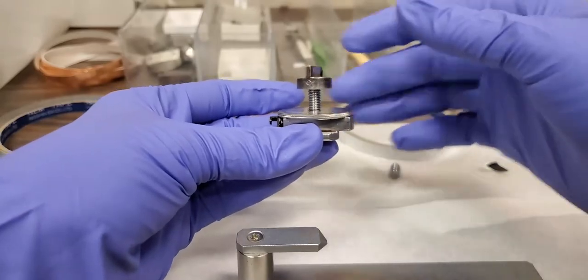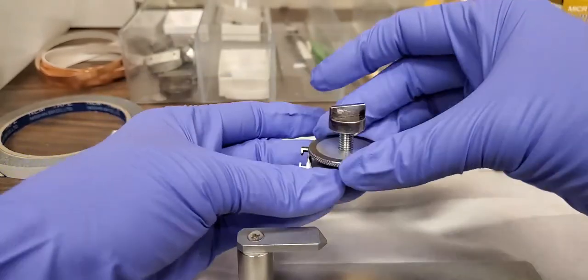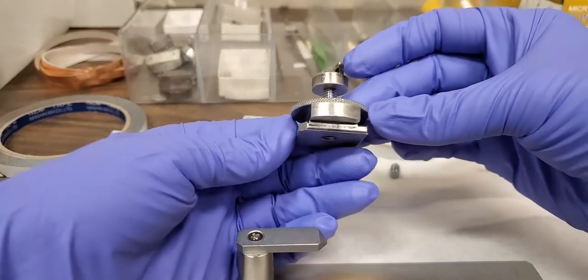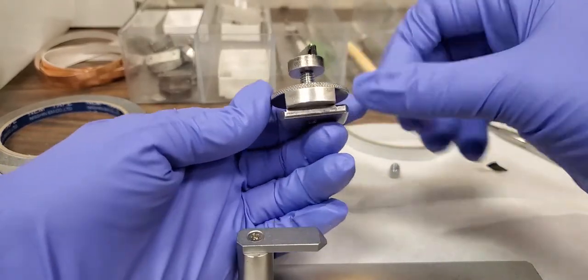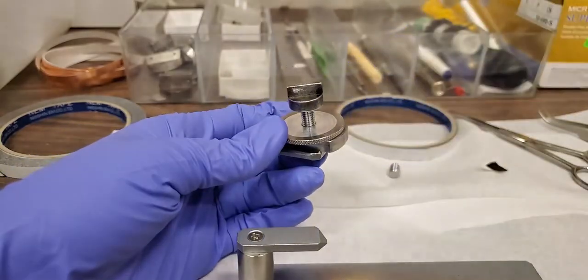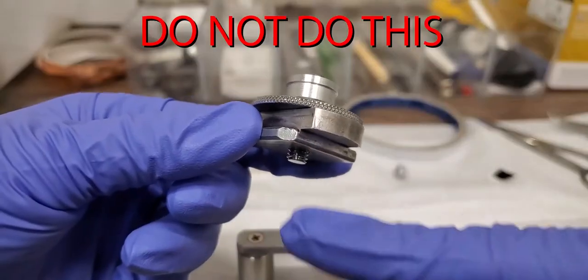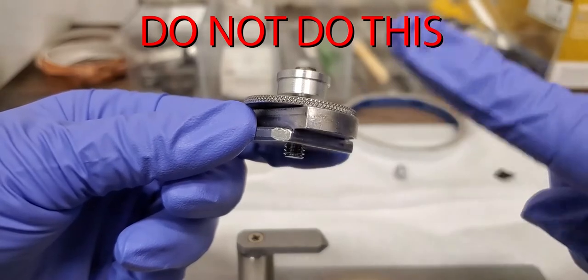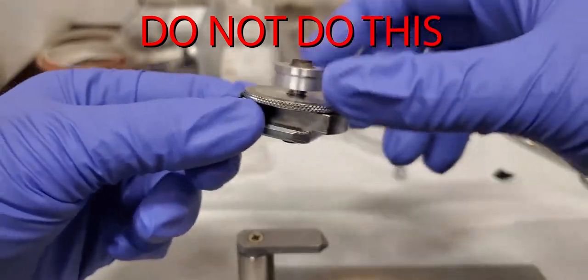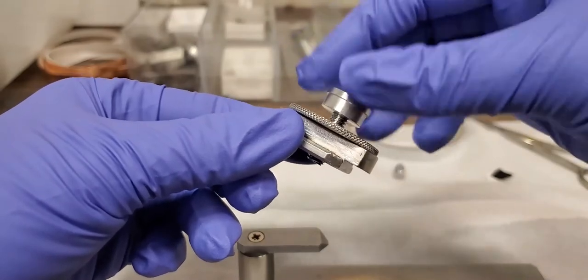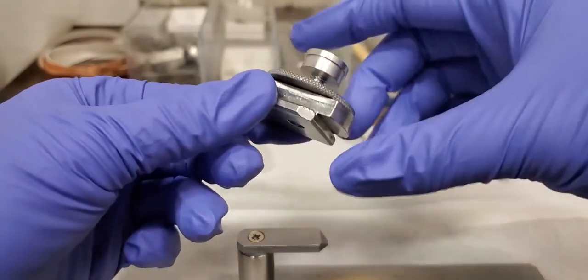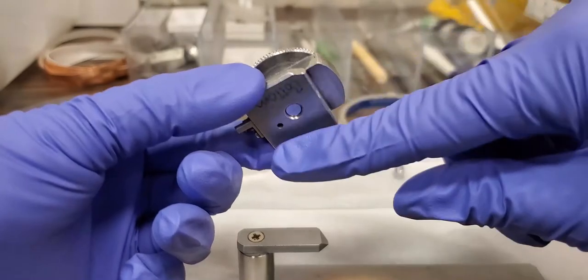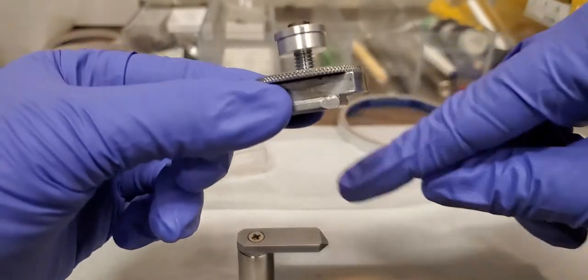Also note, anytime you prepare, do not over-tighten the set screw or strip the screws. The second critical mistake you can make is tightening the screw down too far below the bottom of the base. This is a critical mistake. You cannot do this. Make sure it is not beyond the bottom. If your sample is really tall, use the short screw to prevent this from happening.